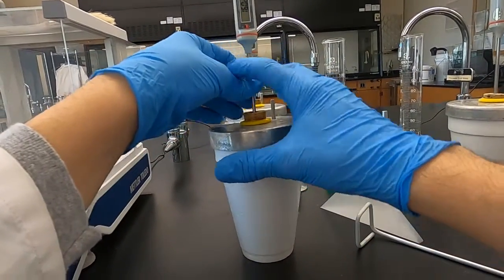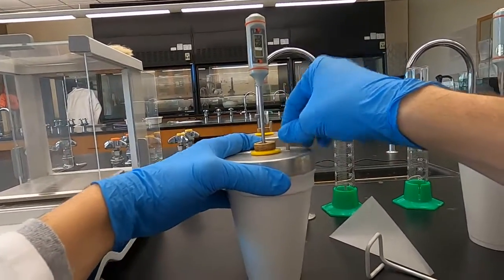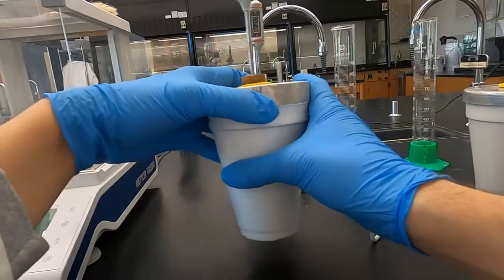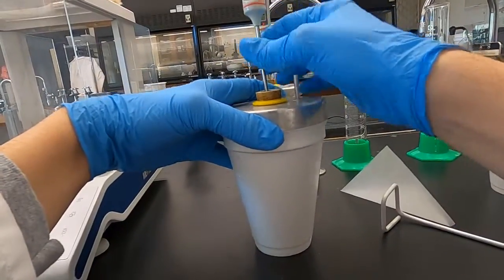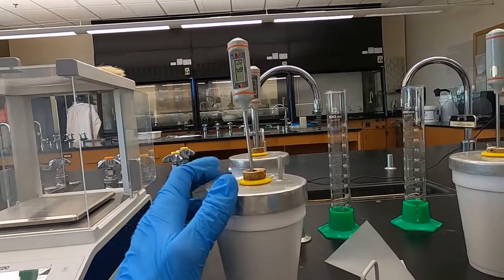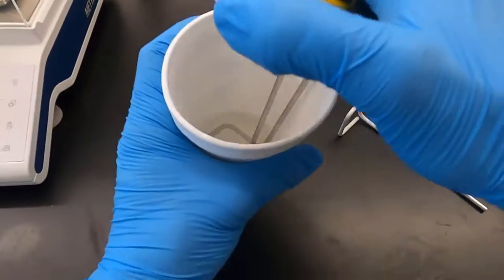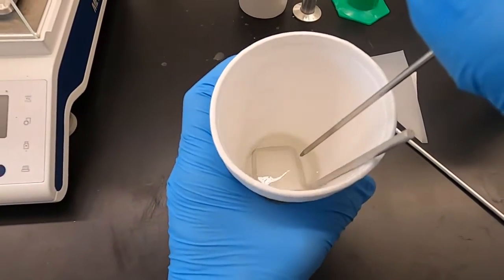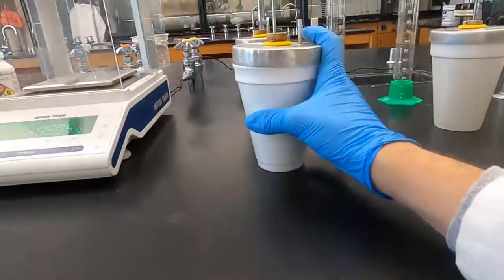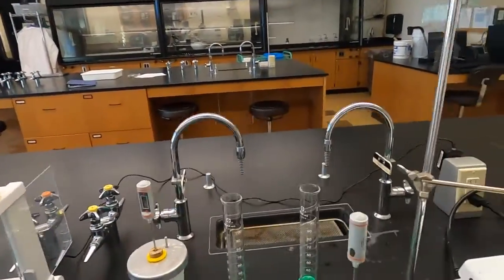So it's on the climb. We went to 15.9. Let's see if we can get it back down. It's up to 16 now. And we're rising up, 16.1. Let's double check this. And no solid remains. So 15.9 degrees Celsius was our final temperature. Subtract the initial from the final, and that will give you your change in temperature. So put this off to the side.